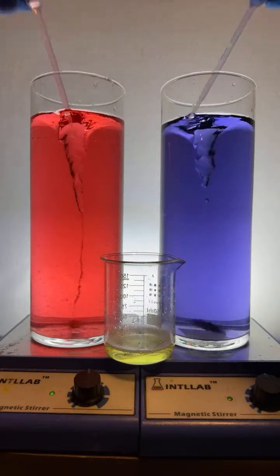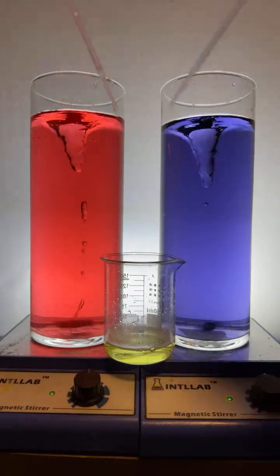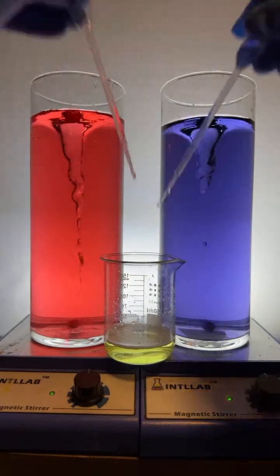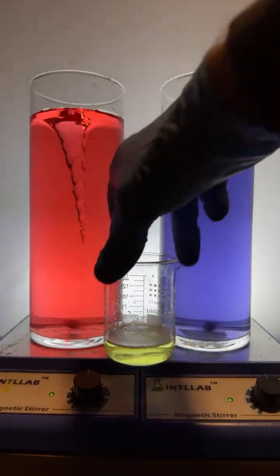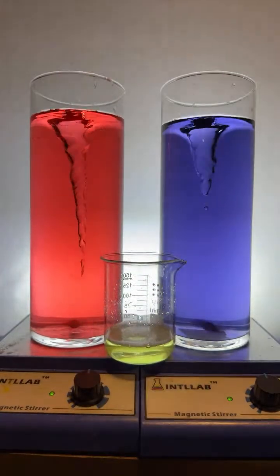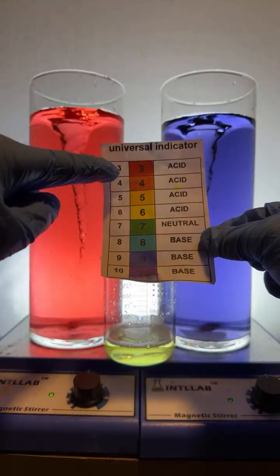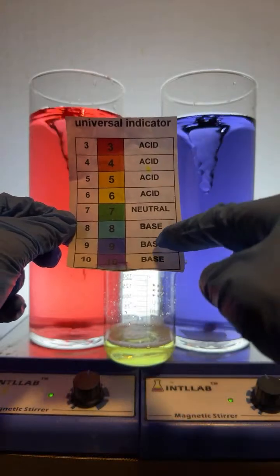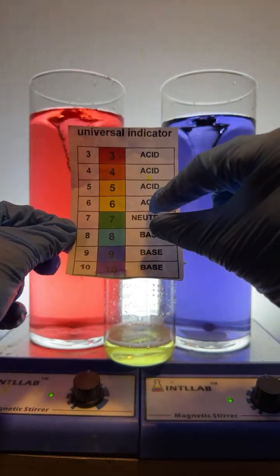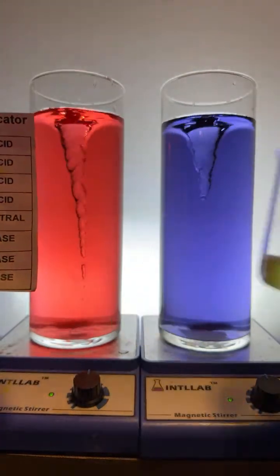And you can see, as I'm squirting them in there, what we're basically ending up with is, it looks like, a yellow-green colored solution. See that? And that makes sense if you know what's going on with acidity and basicity. That is, this stuff over here has a pH of 3. This stuff over here has a pH of 9 or 10. And when you mix acids and bases together, they neutralize each other. So the pH is going to come closer to 7. And you can see this looks maybe like a pH of 6 or 7 when I mix the two together. So that is expected.